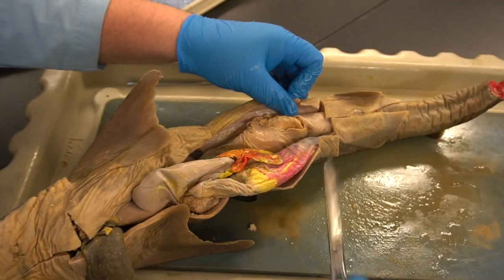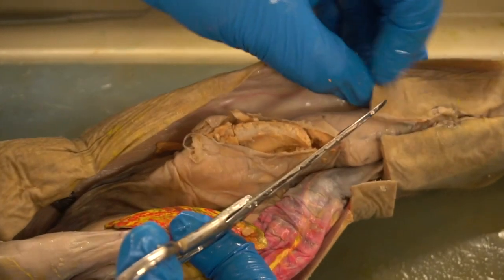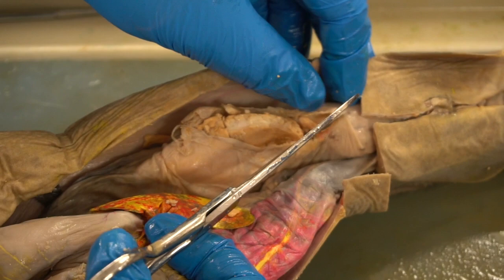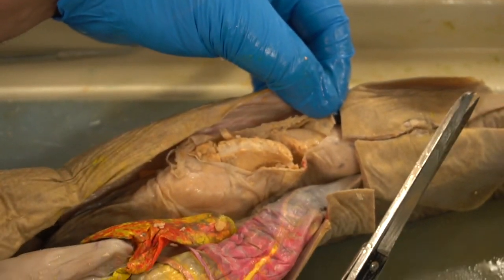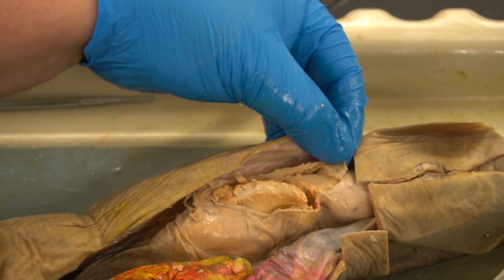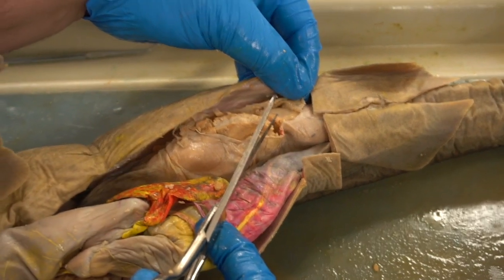Now this one's already busted open, so we have a pair of scissors there. I'm going to use the sharper side and just cut the wall, and you see how thin the wall is, comparatively speaking, but very, very stretchable. This is very similar to a uterus that you'd find in any vertebrate. It's not very thick-walled, per se. It's surprisingly relatively thin, but extremely flexible.